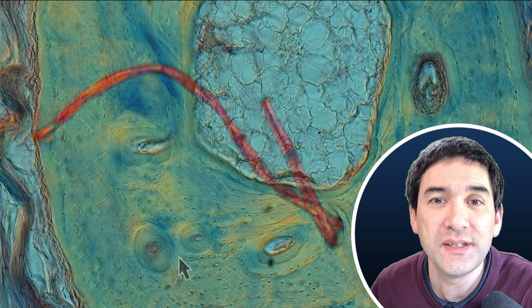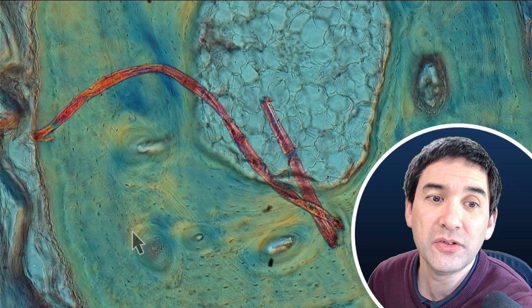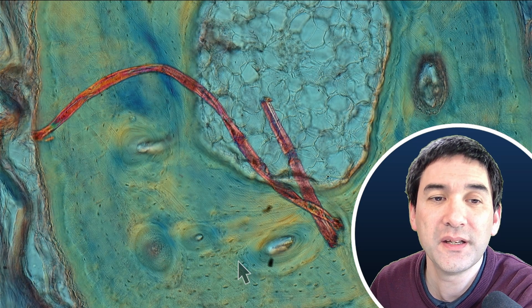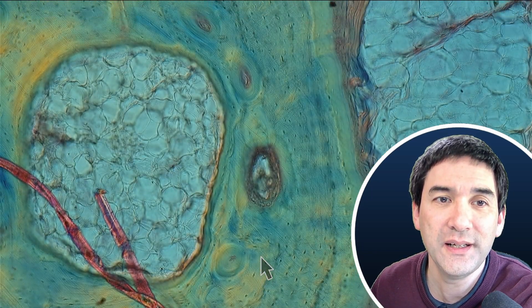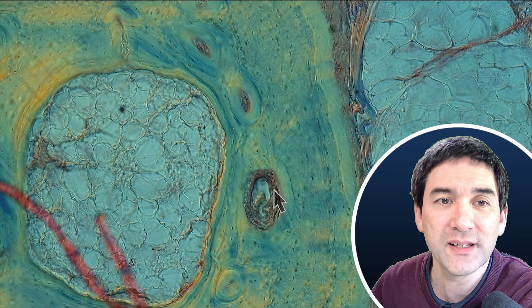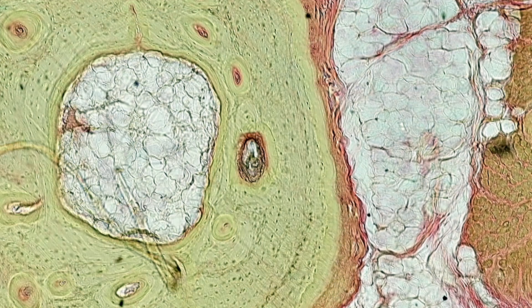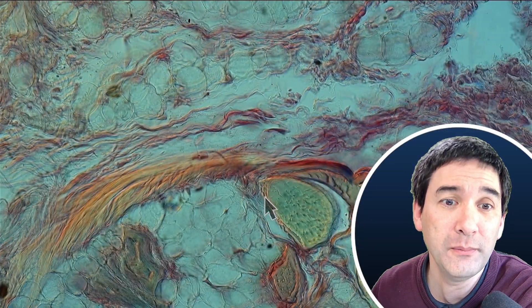What we're looking at right now is bone. Even bone is made of cells — we're able to see those tiny little individual cells. Over here on the right side, also quite nice. This looks to be like the cross-section of a blood vessel. After all, bone is a living structure that needs to be supplied with oxygen and nutrients, and of course there are also blood vessels in there. I was also able to find a few other blood vessels.